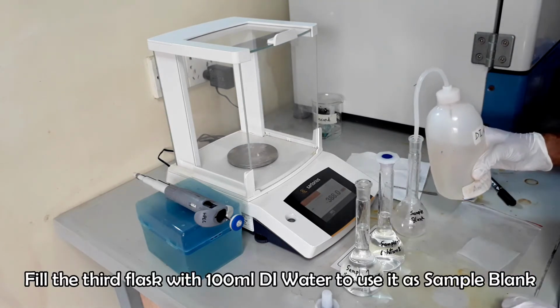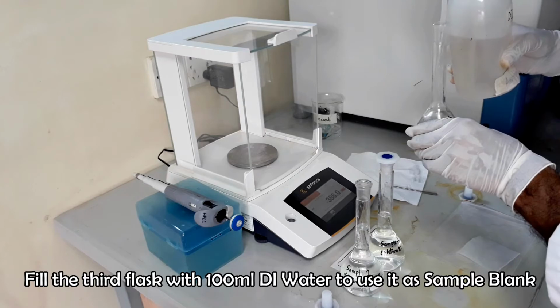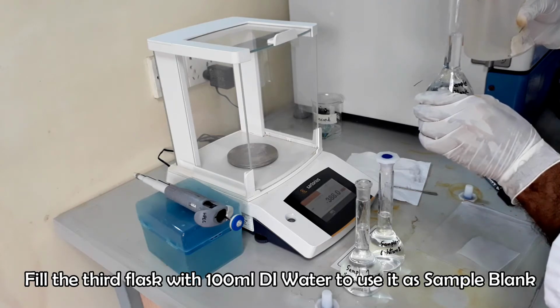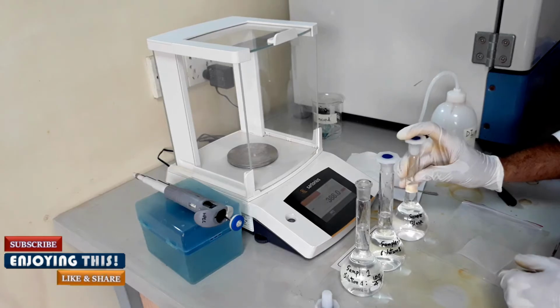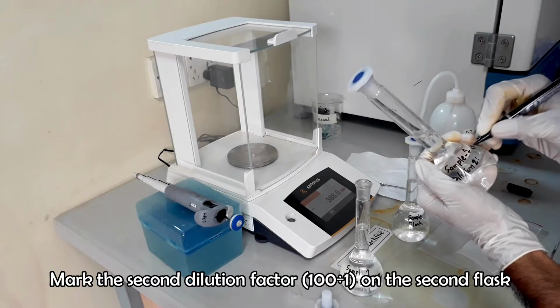Fill the third flask with deionized water, which will be used as sample blank. Mark all the dilution factors on the dilution flask.